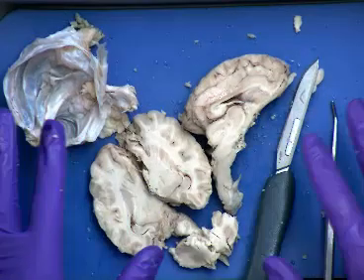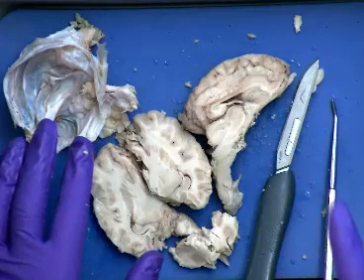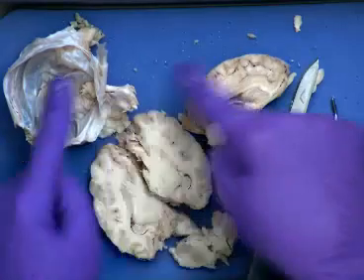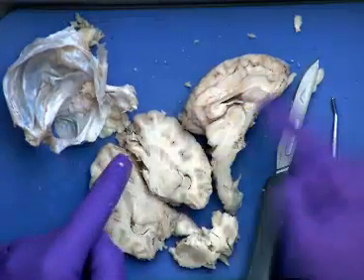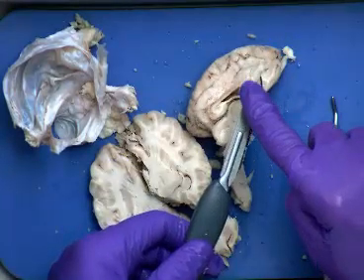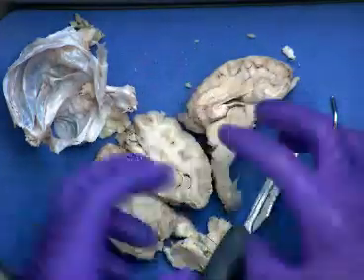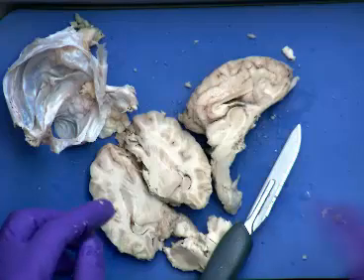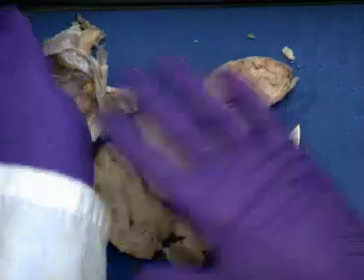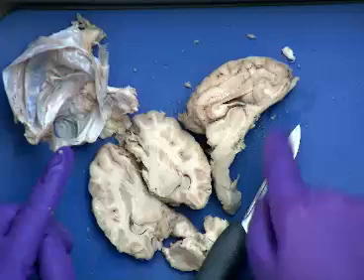And do the dissection, identify the structures, and then when you're done, there's a bin on the ground there that has a red bag lining it. So it's a hazardous material container. All of these, since they're preserved materials, need to go in there. Any pieces and parts, little bits and pieces like that, have to go into the container. So the halves of the brain, any of the pieces and parts go into the container, and then rinse your dissection tray. You can also remove this insert here and rotate it 90 degrees like that so that it can dry. So you're going to rinse it all, but make sure no pieces are going down the sink.